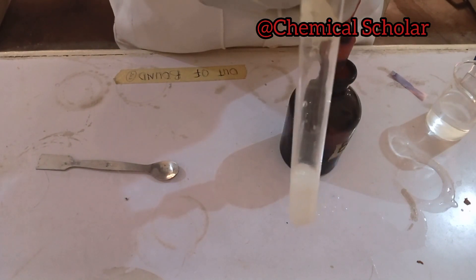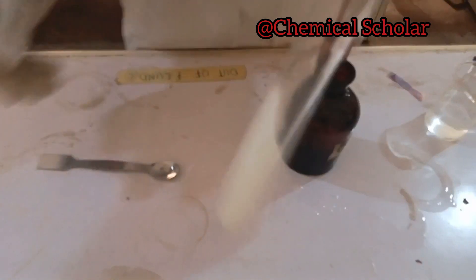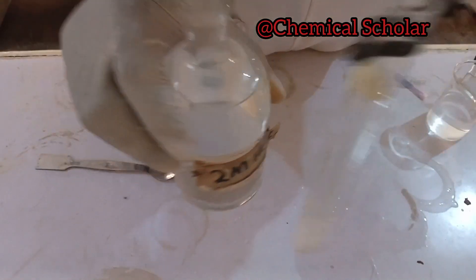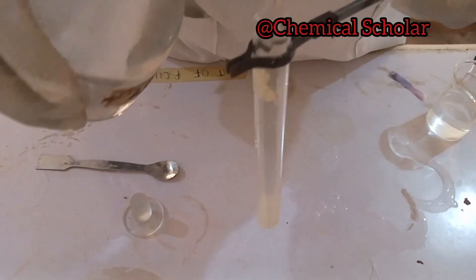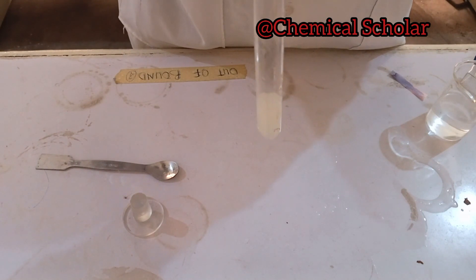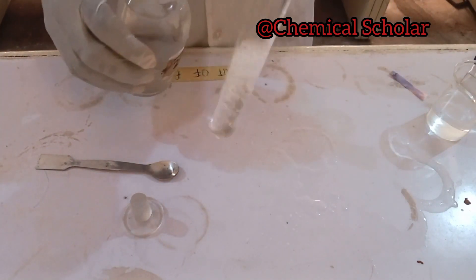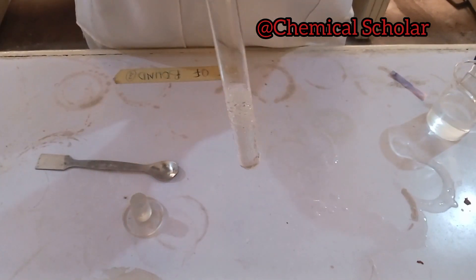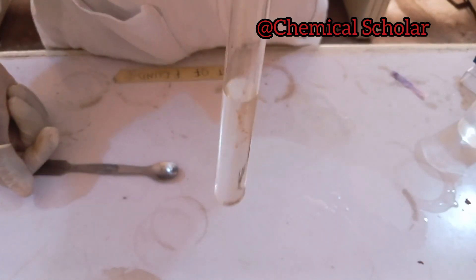As we add barium chloride solution to the salt solution, it gives a white precipitate. Now we react the barium chloride plus the salt solution with dilute HCl to see if the precipitate dissolves. If it dissolves in dilute HCl, it means the ion present is CO₃²⁻. And you can see the precipitate has already dissolved in dilute HCl, confirming CO₃²⁻.